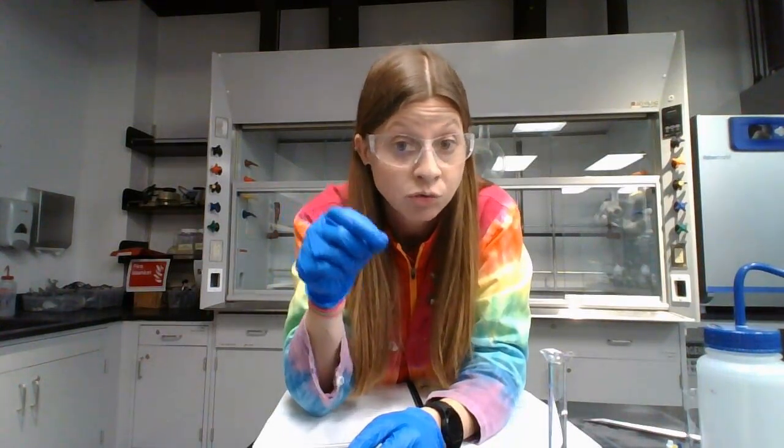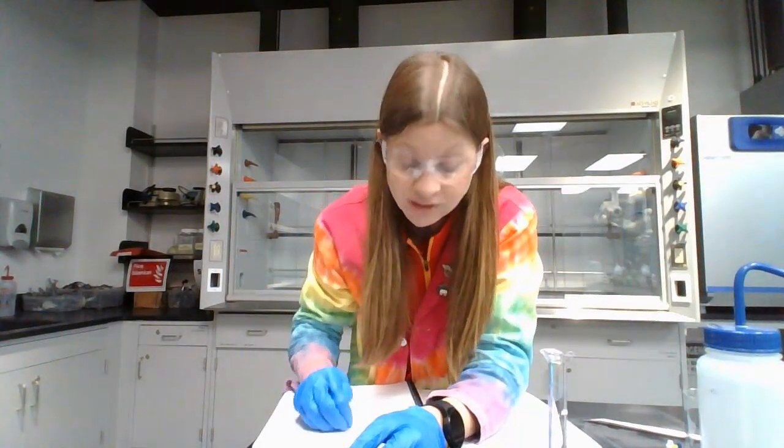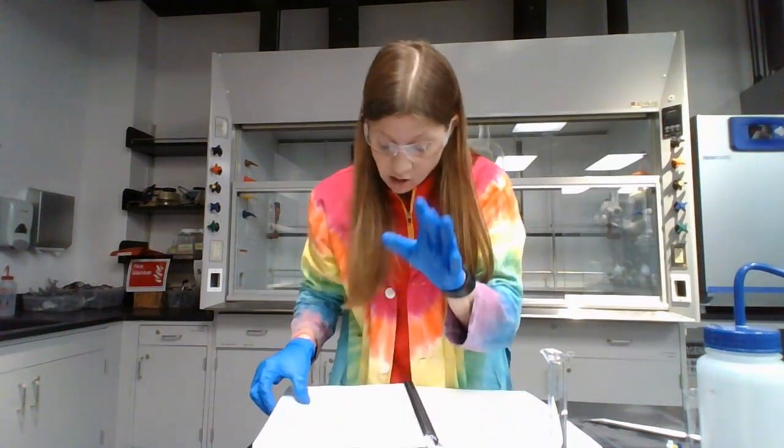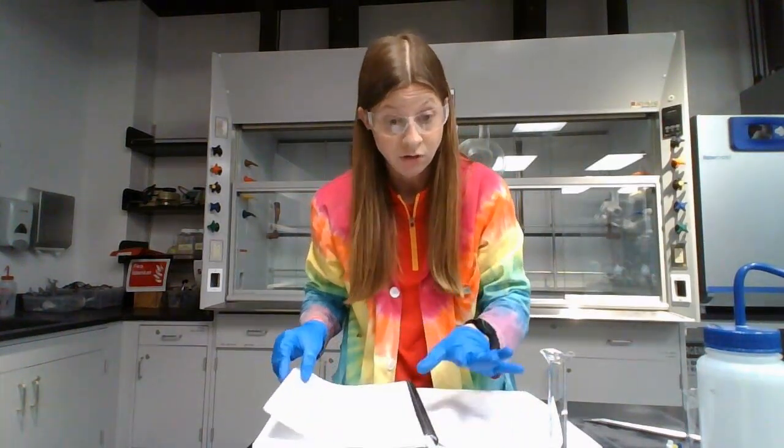And then somewhere in the nutritional label, it'll say how many milligrams, usually it's milligrams, of sodium are in a serving. So you're recording that as well. So those are in the data table. They're not calculations. They're coming straight from the label. The rest of the lab are calculations.